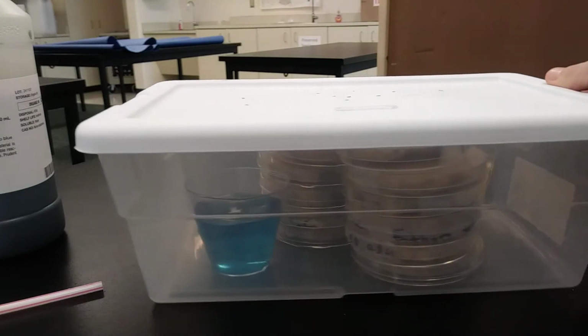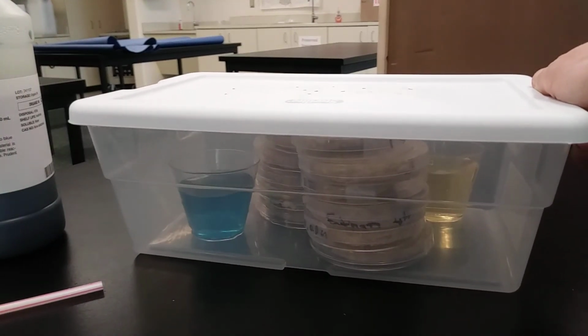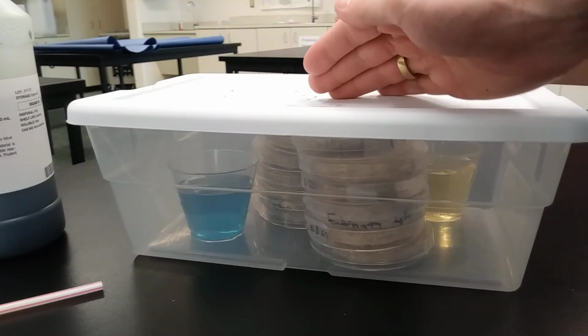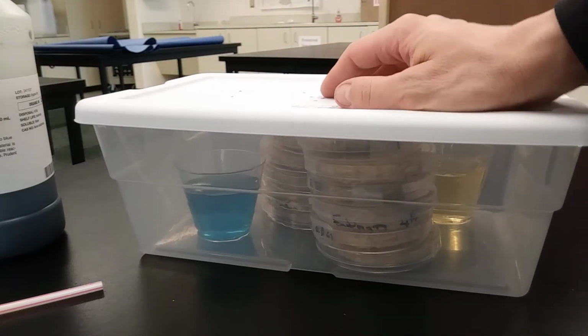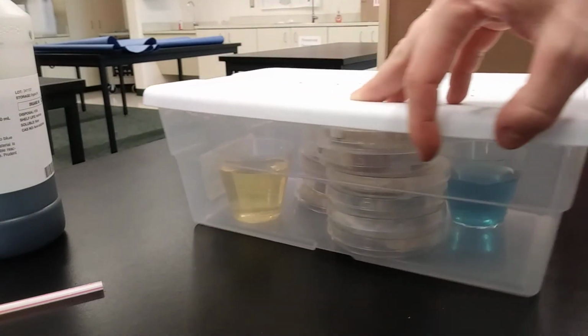So this isn't quite airtight, but it is airtight enough for us to be able to try to find out: is our fungus putting out carbon dioxide, or is carbon dioxide going into it? So that's what we're going to go ahead and do with this investigation. So I'll go ahead and put this in a dark, warm place so that our fungi can live safe and sound over the weekend.